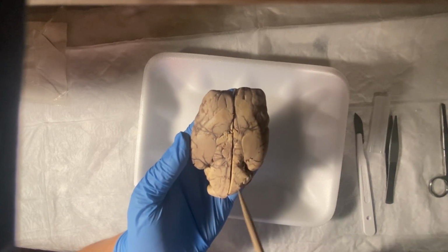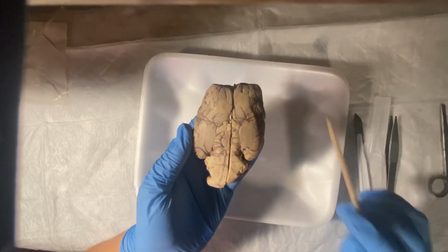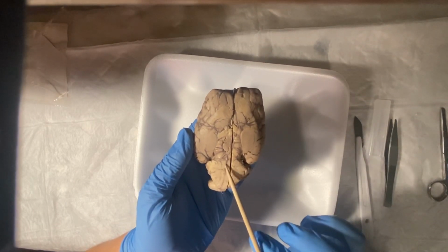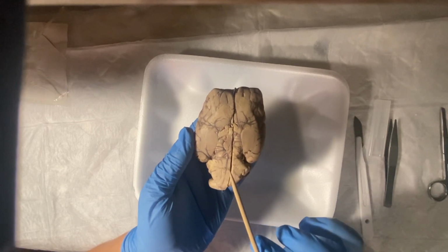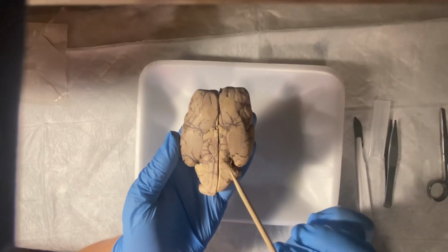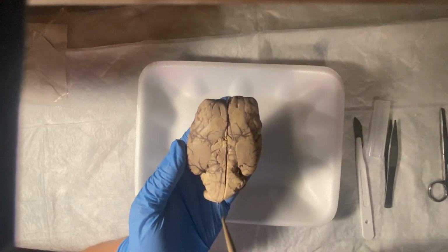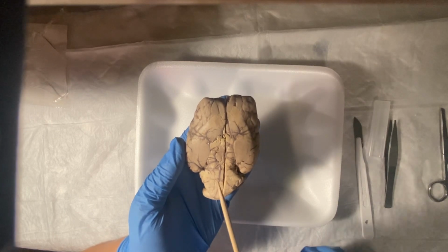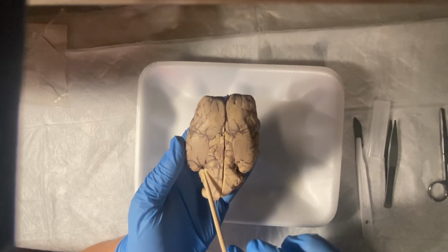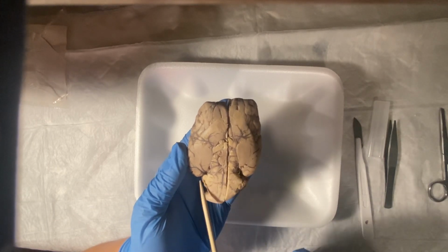And that's the trochlear nerve, cranial nerve number 4. And those are underneath cranial nerve number 5, which would be the trigeminal nerve. So if we look at cranial nerve 5, the trochlear nerve is under, and cranial nerve number 5 is above. So it is around here, I believe, right here. These are the cranial nerve number 5s.